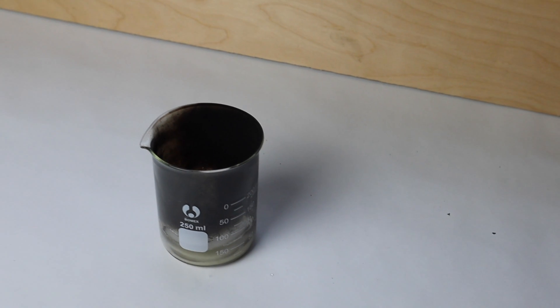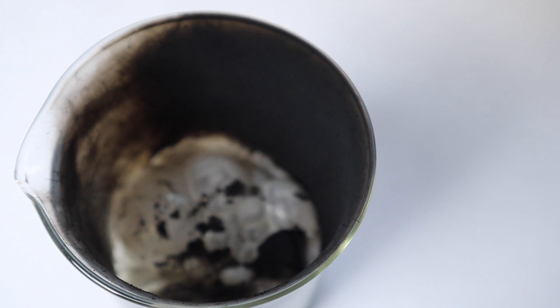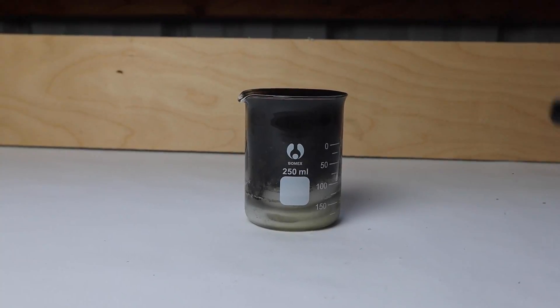Okay, so the flame has gone out. And if we look inside we can see that acetylene gas is still clearly being produced. I'm going to try and reignite it.